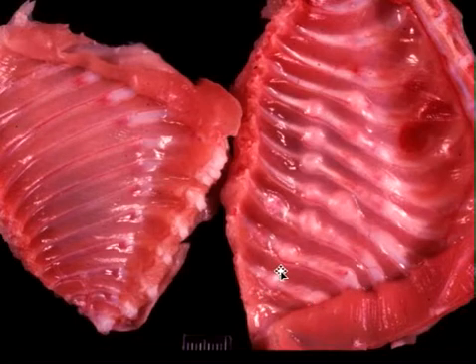Second thing is cats can make their own vitamin C, so they're not going to get scurvy. And the third thing, if you look very carefully, on the left we have a normal rib plate. This is where all the lesion is, and you can see that we have nodular areas and multiple places along the rib, sometimes twice on the same rib.